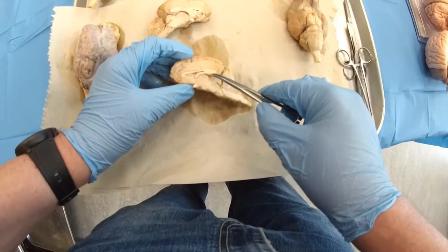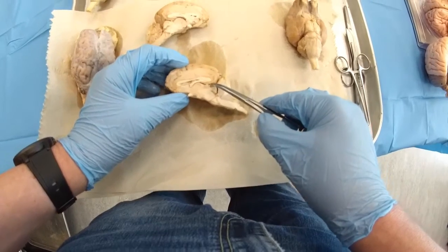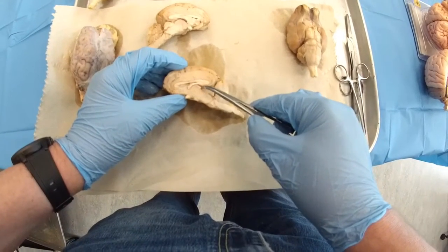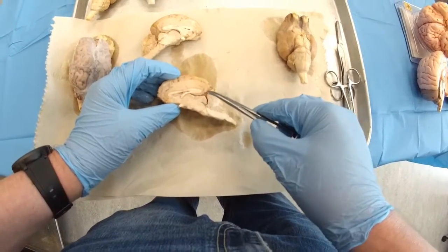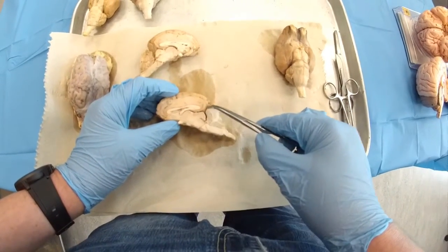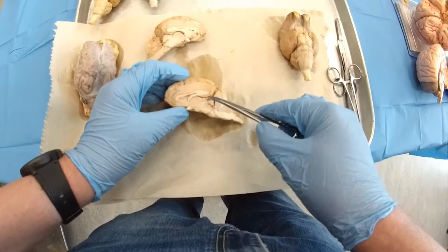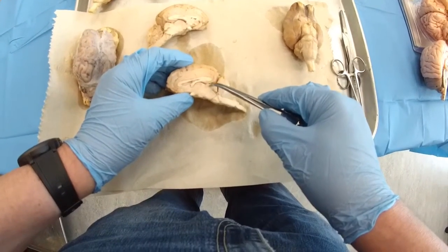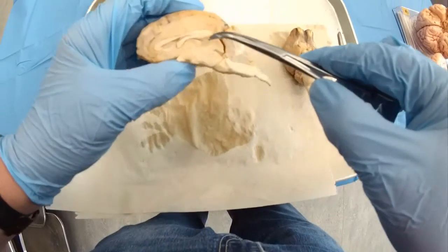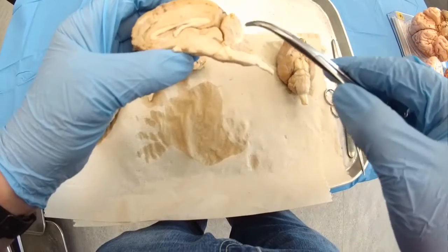Behind the thalamus, this is going to be the area of the epithalamus, and most important, this large structure is going to be called the pineal gland or pineal body, famously known for production of melatonin, which regulates biological rhythm or circadian rhythm. You can see the size in sheep is quite big compared to the human brain.